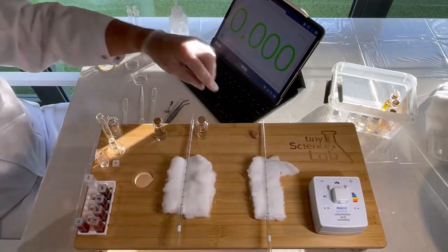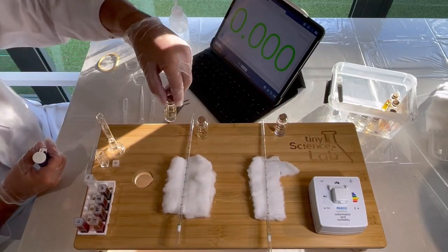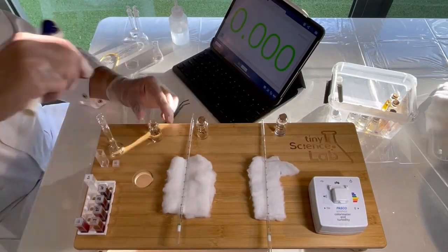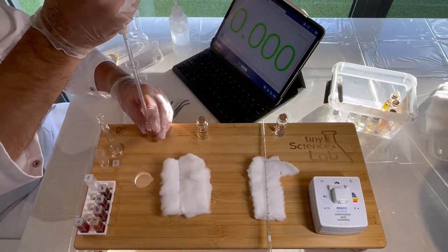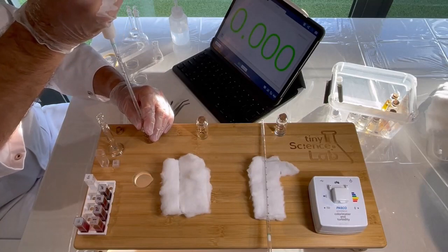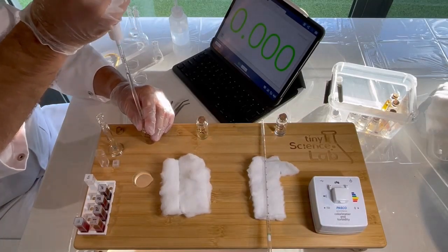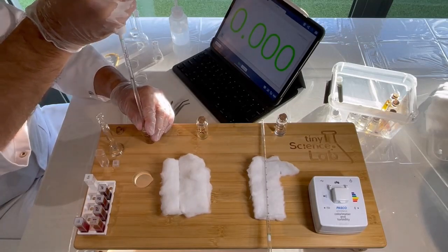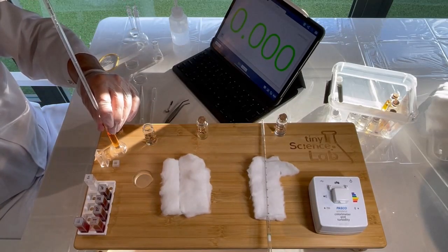The color is very faint. There's not very many ions in there. Well, actually there's a very large number. It's just that comparatively to the water they're not as high, and therefore they don't color the water to the same extent. So let's have a look and see what sort of result we can get. And again, we're going to use 2 mils. So we have a total of 4 mils, which has been our yardstick all the way through.